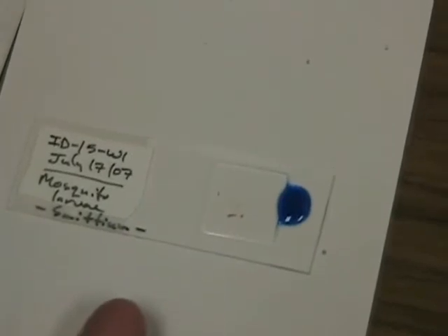This will infiltrate under the slide. When it has infiltrated completely, you will then seal with standard fingernail polish.